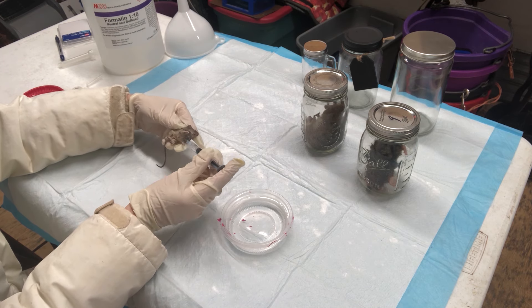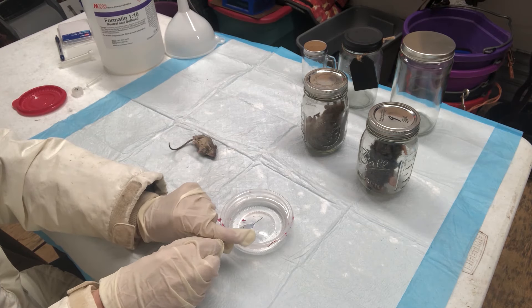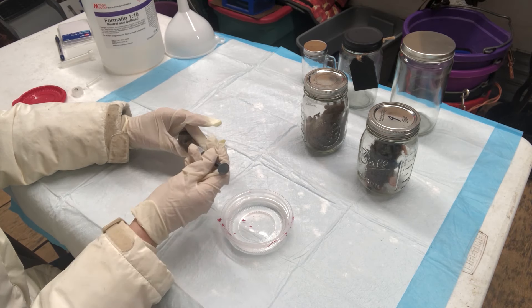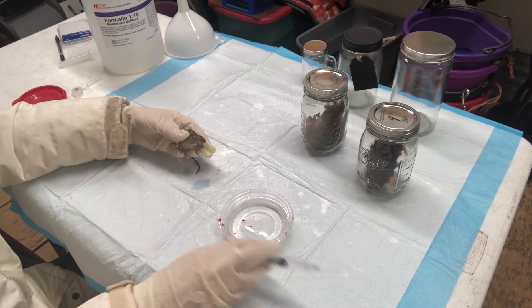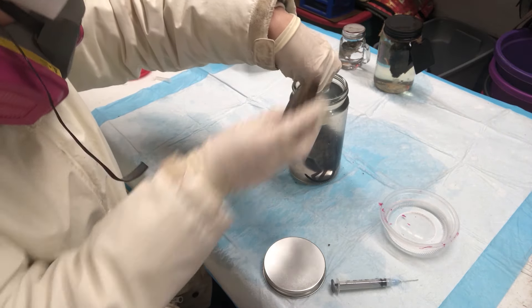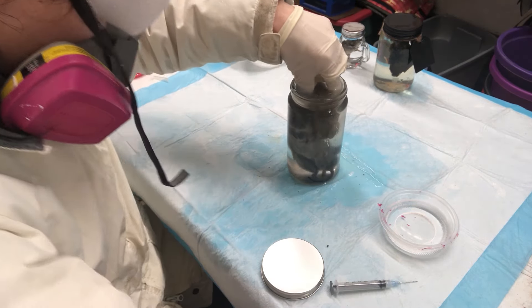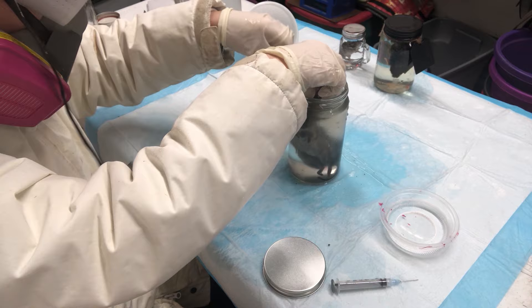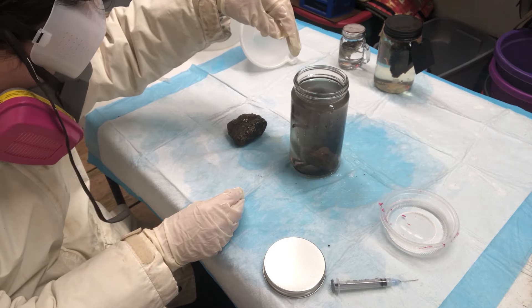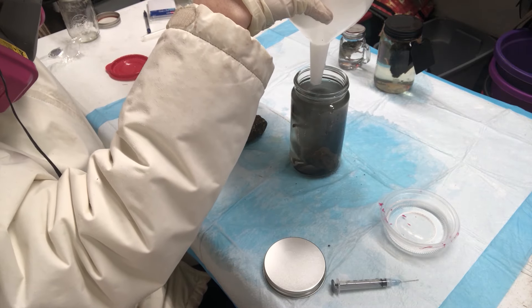The rest depends on how large your specimen is. Since this mouse is so small it won't need much else, but I went ahead and got the thighs and some other spots. This step does more than just preserve them — it actually plumps them up and makes them look more healthy and alive. Make sure to inject in several different areas in the abdomen, not just one spot. I did the same with the rat except with him I made a lot more injections and used more formalin. I then put both in their jars and filled them with formalin. This formalin will harden their bodies over the next couple days, so make sure you pose them the way you want them to stay forever. You can use string to hold limbs up, or like I did here, I used a rock on his tail to weigh him down.